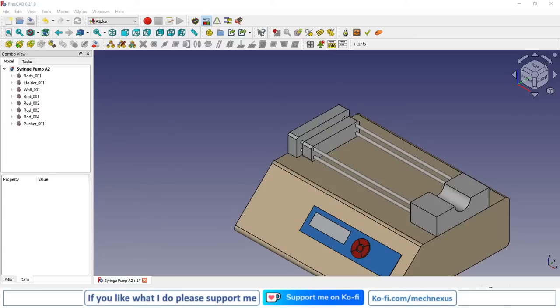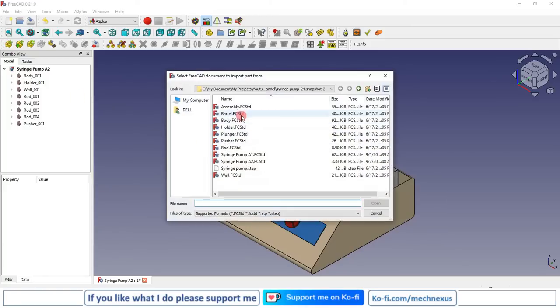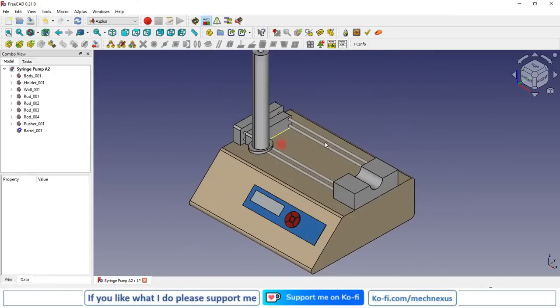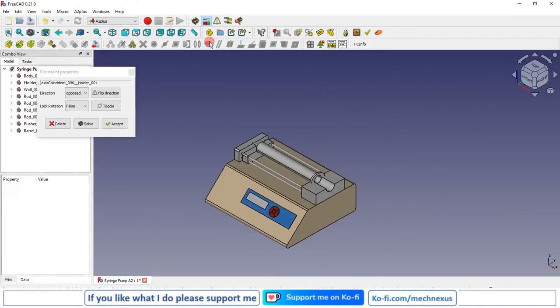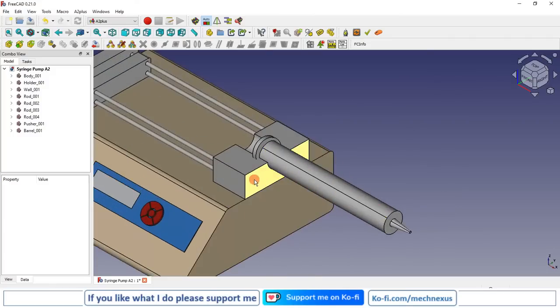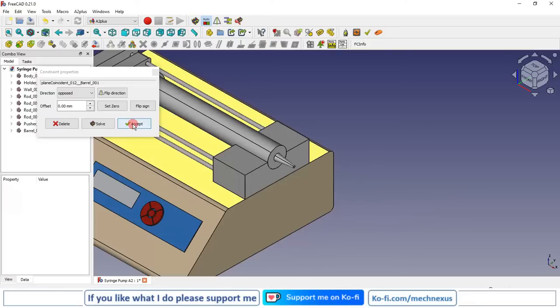Next step is we will insert the barrel. So I will go to add part and select my barrel. I will select the outer face of the barrel and this surface and give axial constraint. Now I will flip my direction and I will accept it. Now I will select this face and this face and make coincidence constraint, accept.